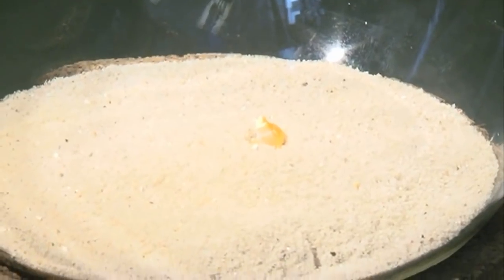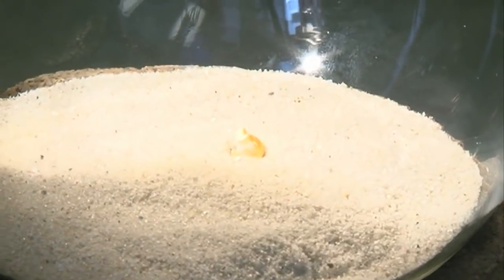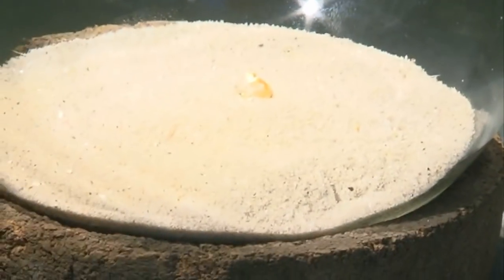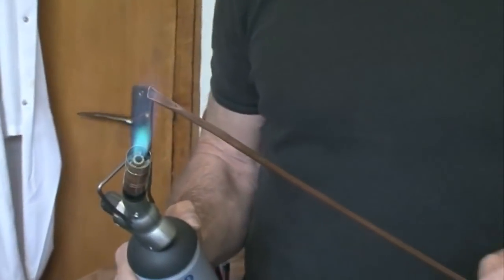So now you can see the phosphorus sitting inside the glass flask which is purged with oxygen. We've put it on a small amount of sand just to raise it off the bottom of the flask.